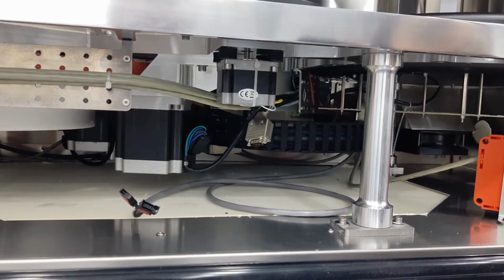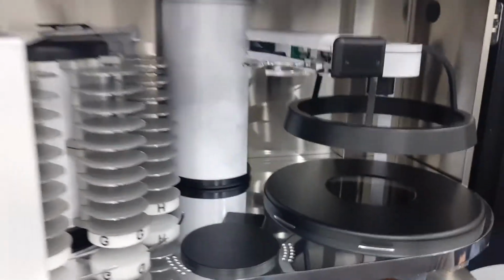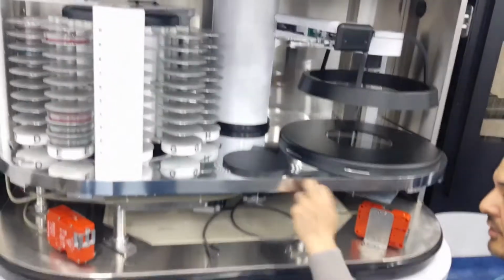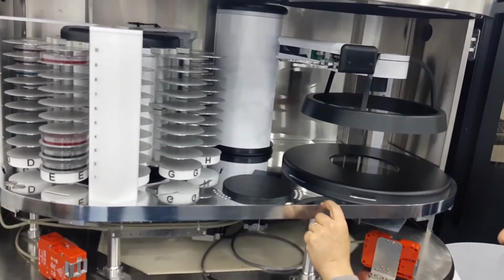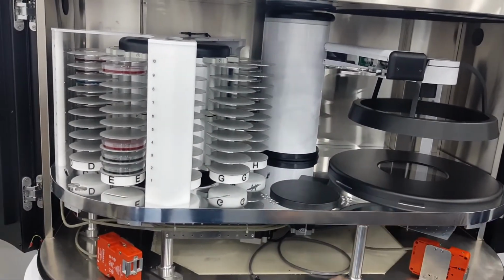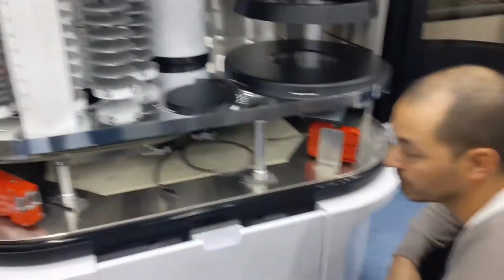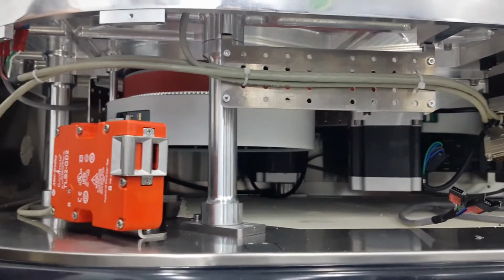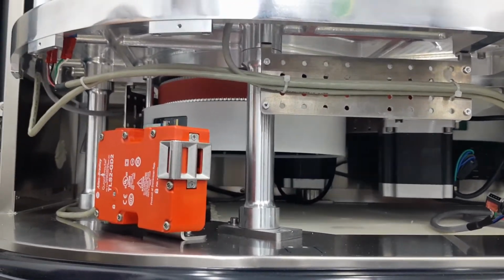And the way the robot is made is that we have a very thick aluminum base, and the carousel and the robotic arm are placed together on the same base, so it's very stable. So there's no reference problem. And actually, the supplier of this very thick plate is the same supplier as they provide for Airbus. The planes, you know. They do the parts of the wings.